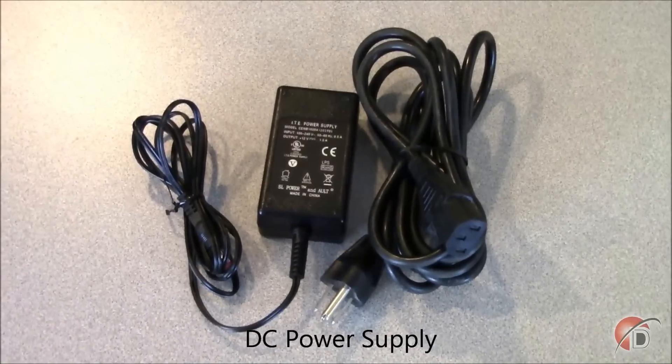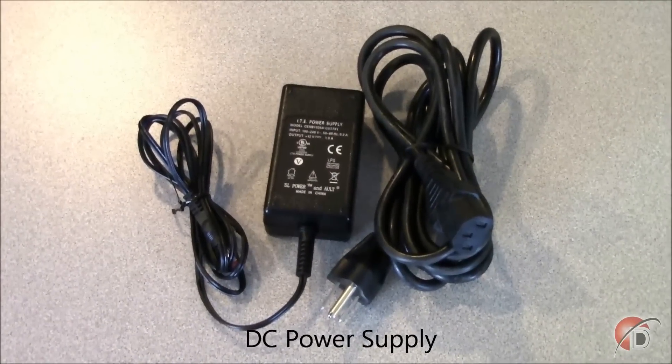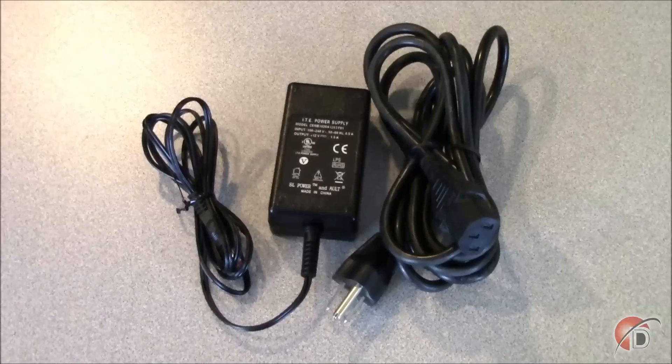You'll also need the portable printer with four AA batteries and thermal printing paper. We are using our 12-volt power input with 12-volt power supply, but for those RAD7s with an AC power input, you may use that instead.